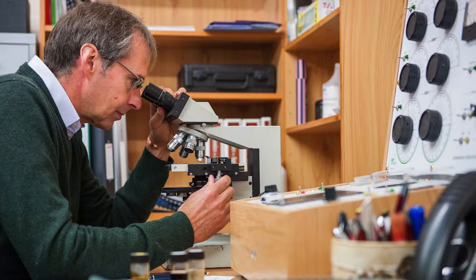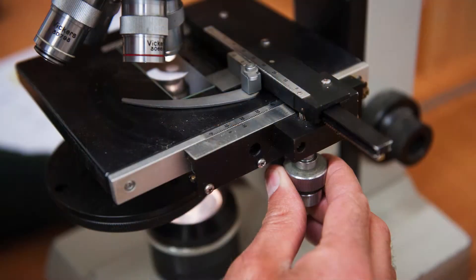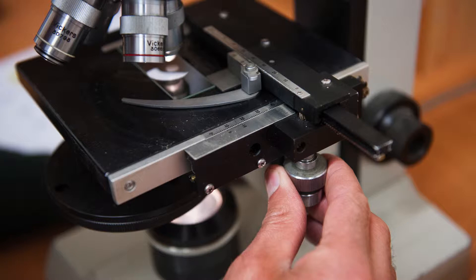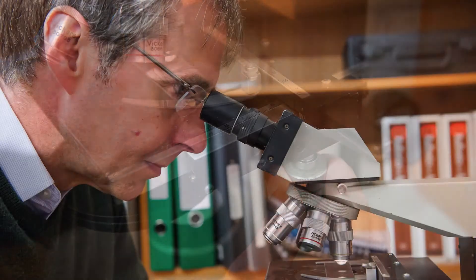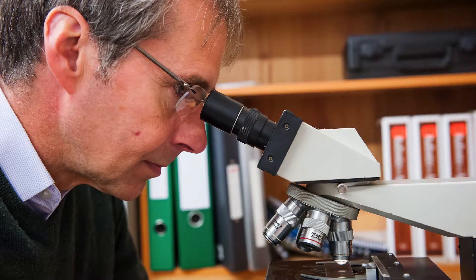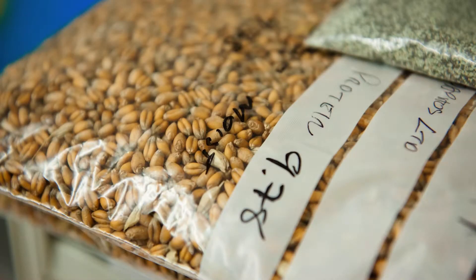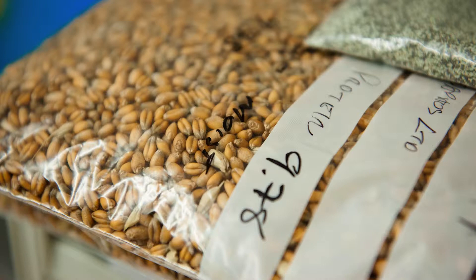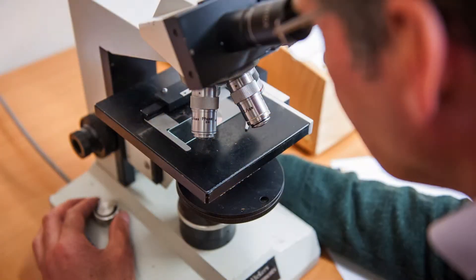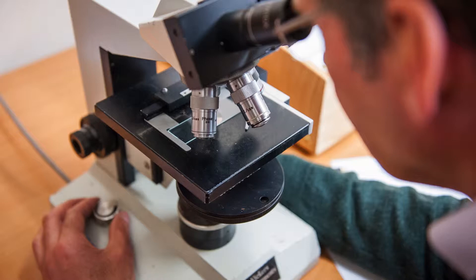What I've prepared here is a soil sample, and the idea really is that we're trying to define the balances of bacteria to fungi. When we look at soil systems and programs, we also look at the balance of biology within a soil. When we're helping to produce those programs and products that we apply to remediate or change sequences, we need to make sure that we can look at how things are developing. This is just one simple way that we can look at the balance of bacteria to fungi within the soil.